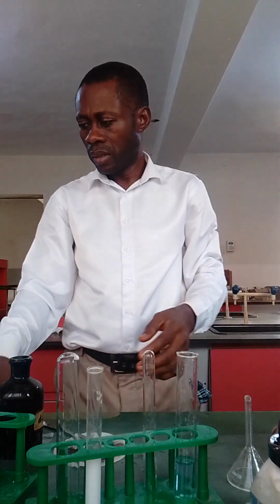There should be effervescence formed to confirm the presence of CO2 gas. So you just write effervescence, odorless gas, confirming the presence of CO2. Then under your observation, write effervescence occurs, then colorless and odorless gas, which turns blue litmus paper red and lime water milky. Then under your inference, that is CO2 gas.